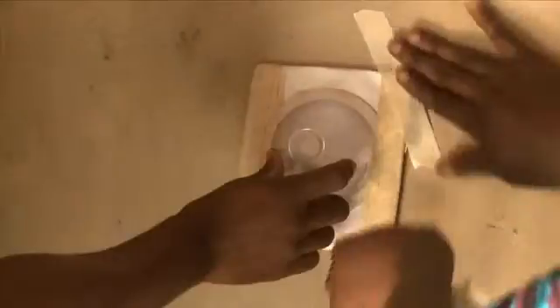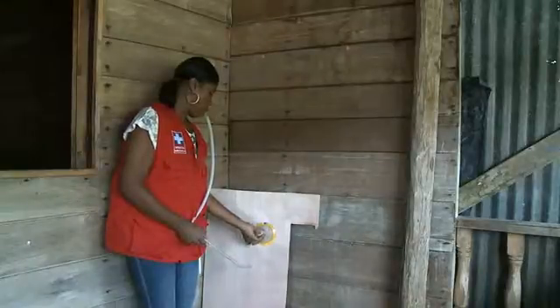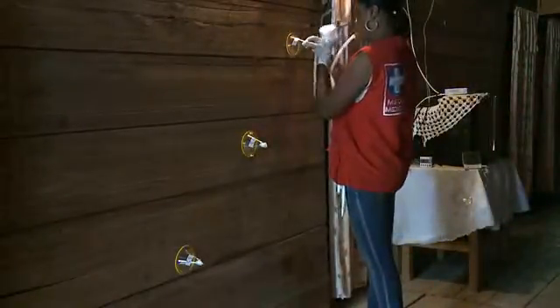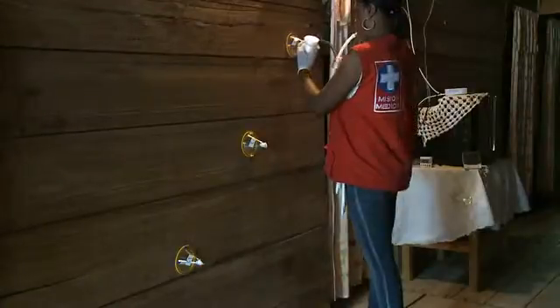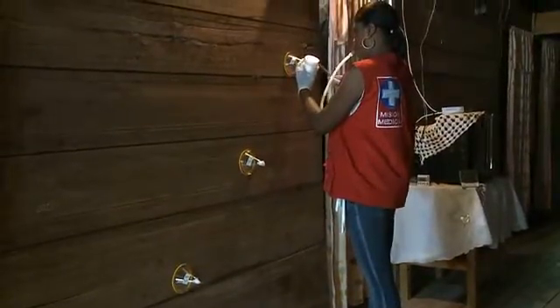As a control, attach plastic cones to insecticide-free paper or a piece of untreated wood, something similar to the surface of the exposure cones. If you have enough mosquitoes, transfer 15 to 20 mosquitoes into each cone and put a piece of cotton wool in the opening of the cone. Remember to use one aspirator for the exposure cones and another for the control.